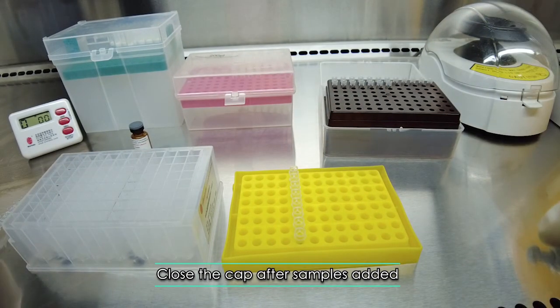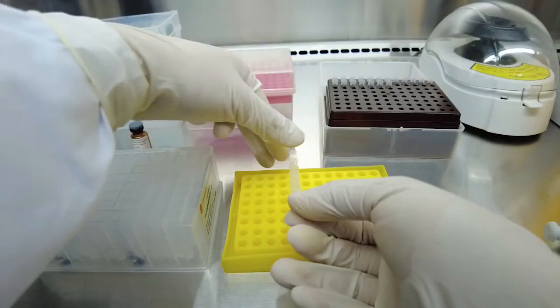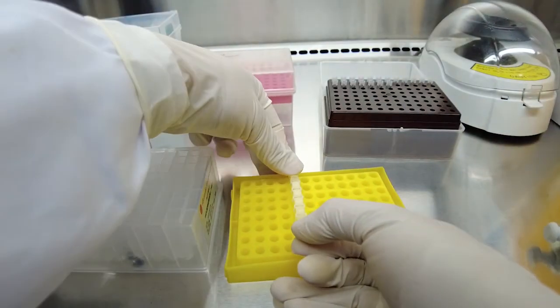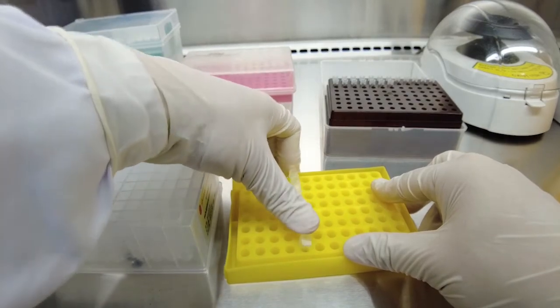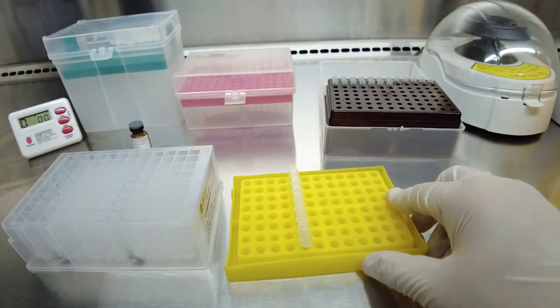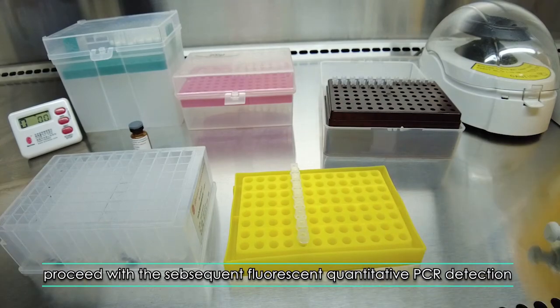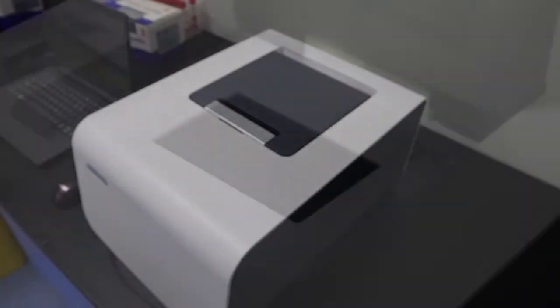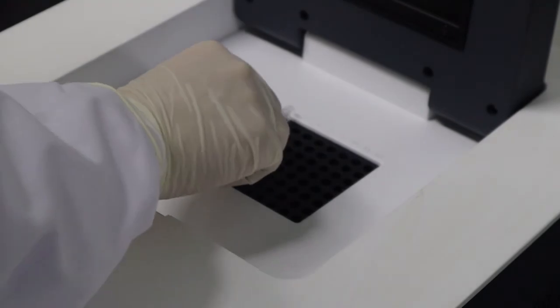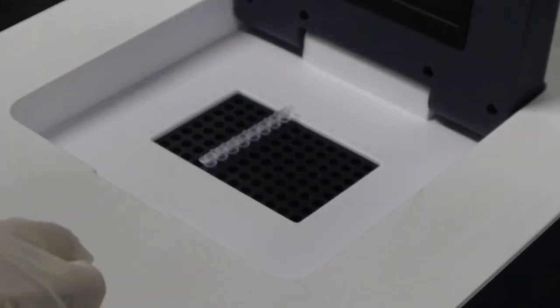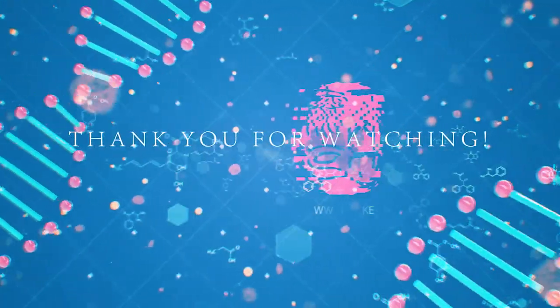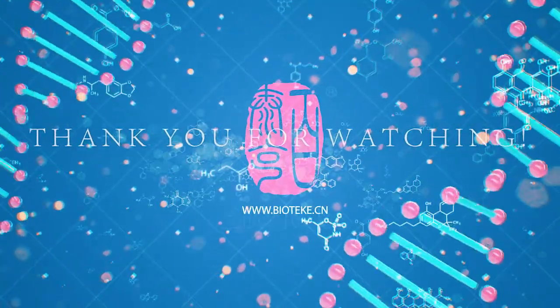Close the cap after samples are added. Proceed with the subsequent fluorescent quantitative PCR detection.